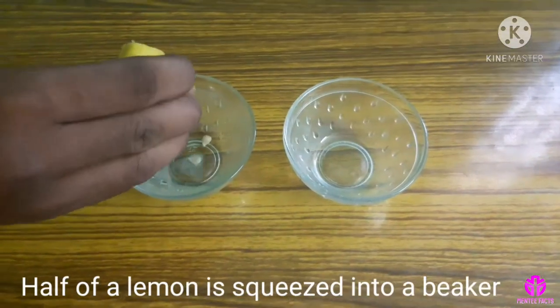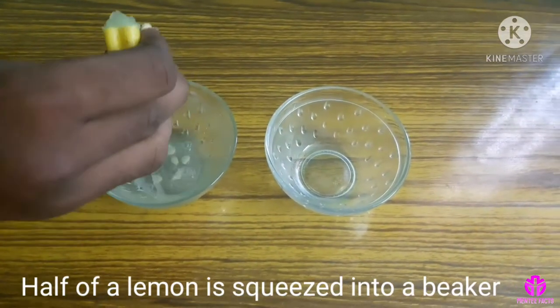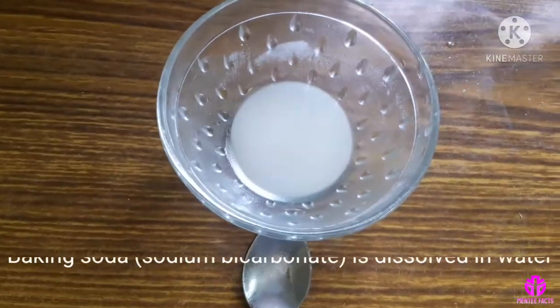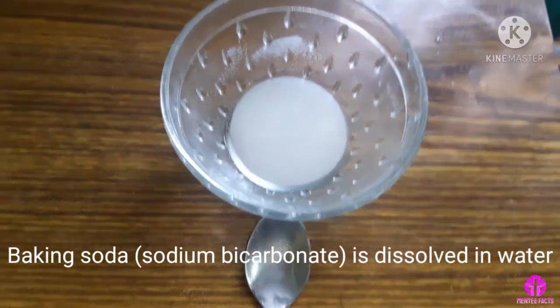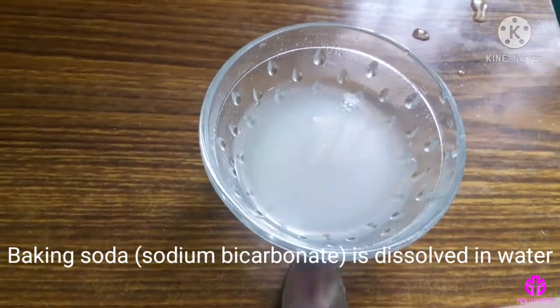Half a lemon is squeezed into a beaker. Baking soda — sodium bicarbonate — is dissolved in water.